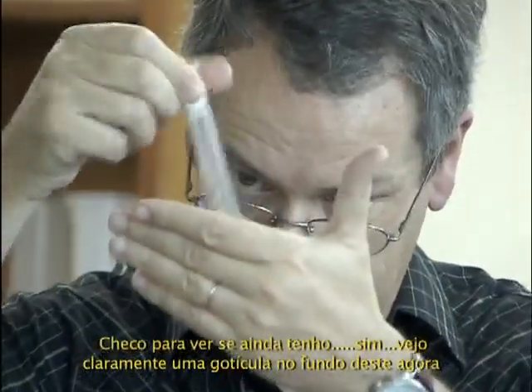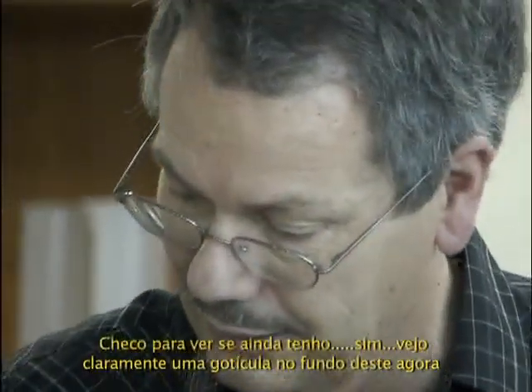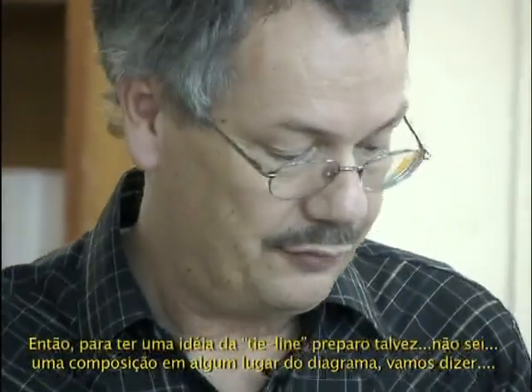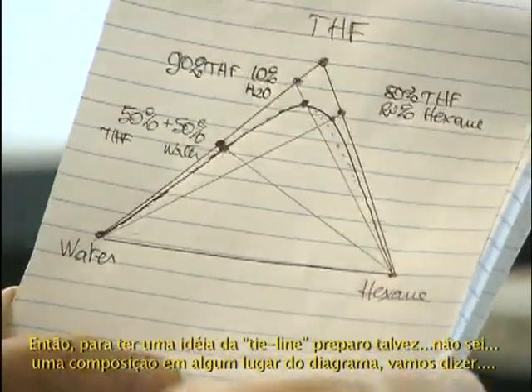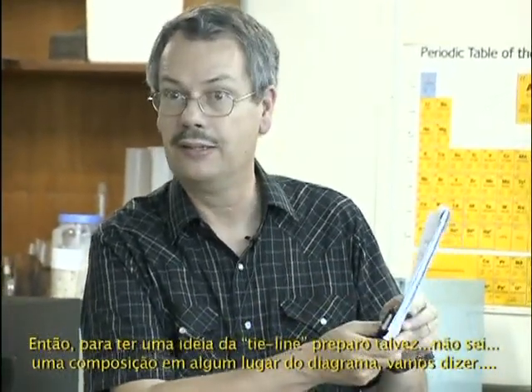I check that I still have, yeah, I clearly have a droplet at the bottom on that one now. So to have an idea of the tie line, I will prepare a composition somewhere in the diagram.